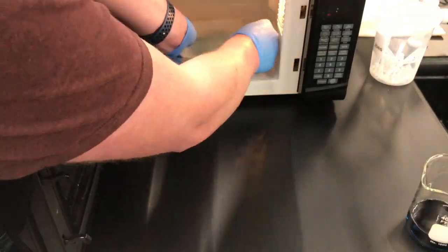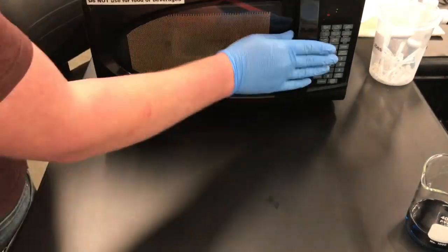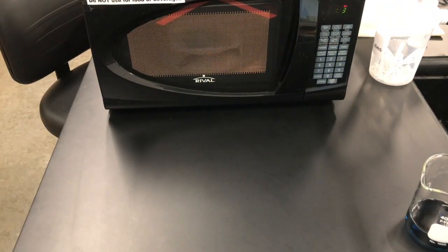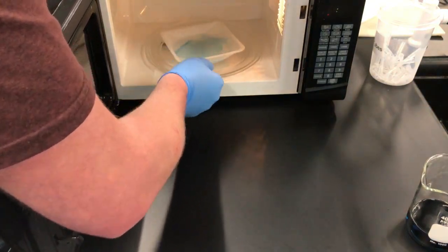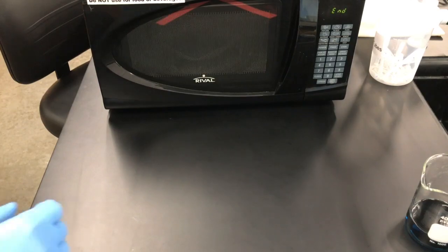Now gel destaining and staining is more of an art than a science. There really is no exact answer as to how many times you need to microwave it, mix it, etc. Really you just keep going until you see what you want to see.